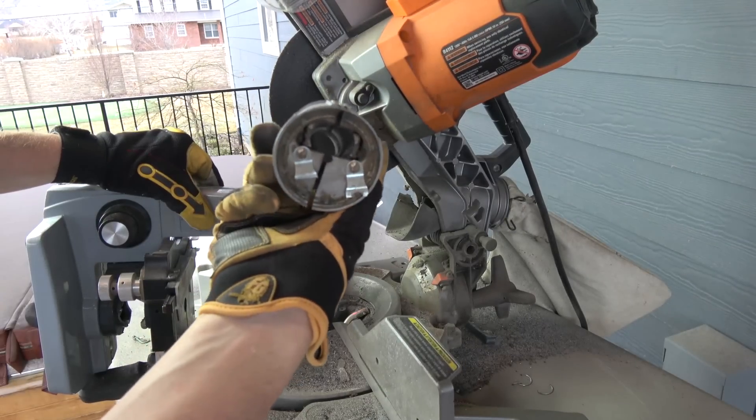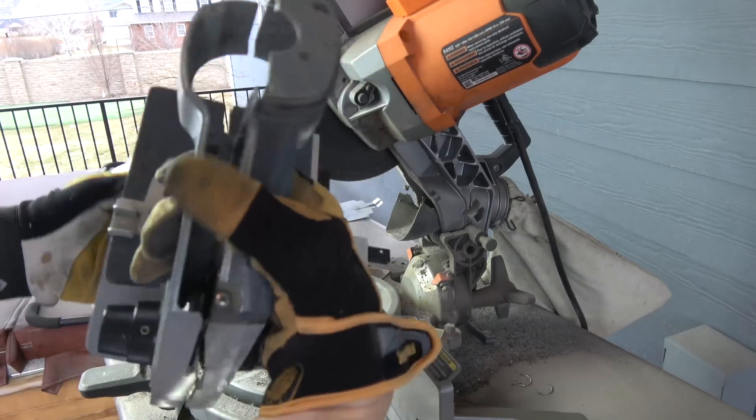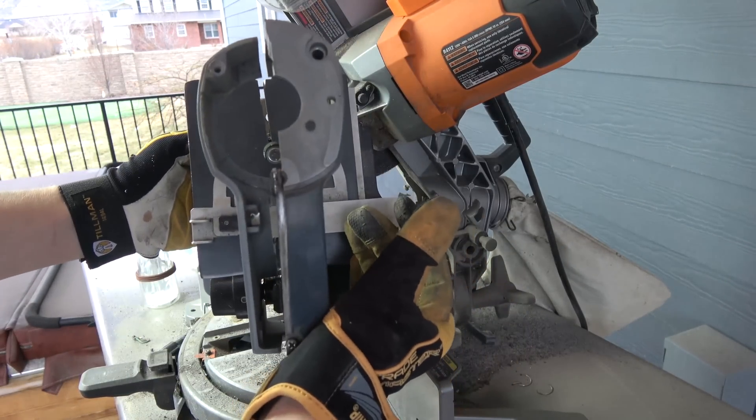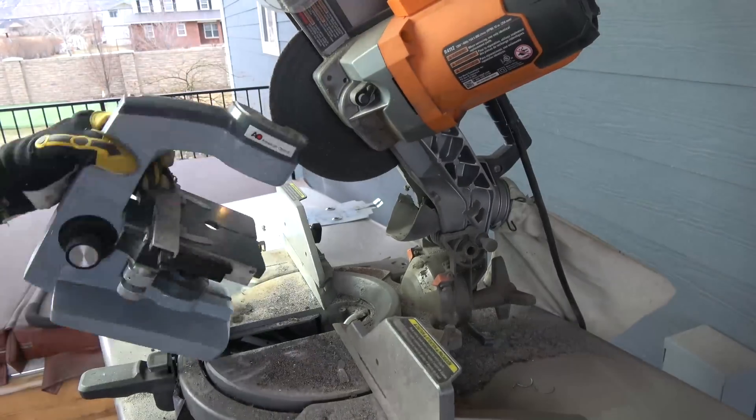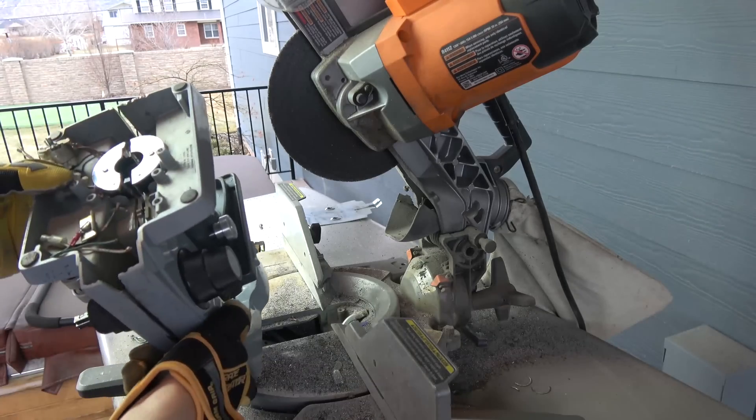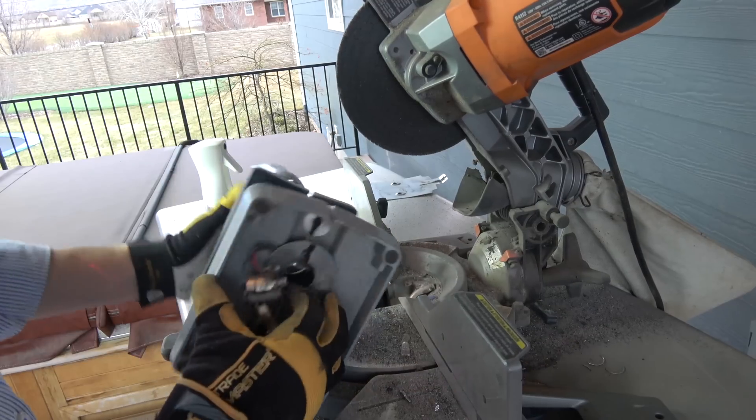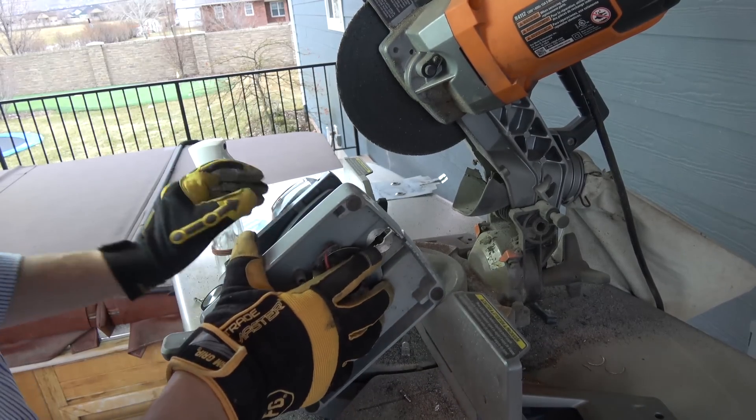Well, we finally got this guy out of the top. Here's where we're at. We're so close. Where is it even holding on still? Not quite sure what the answer is going to be, other than brute force.